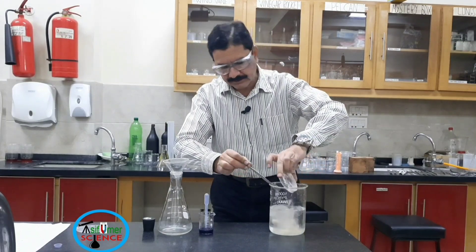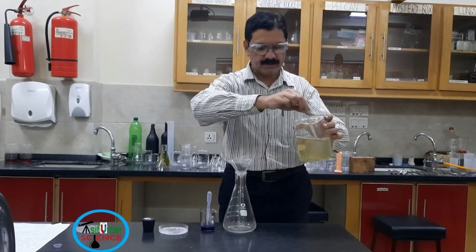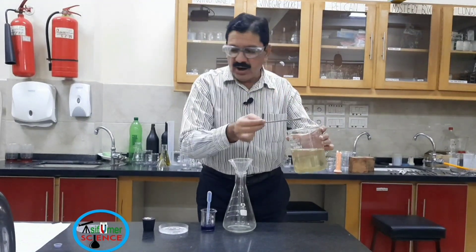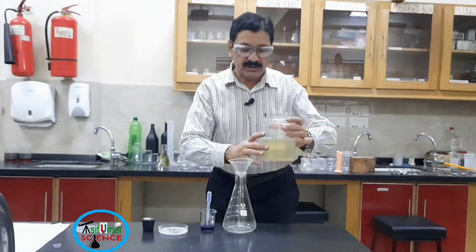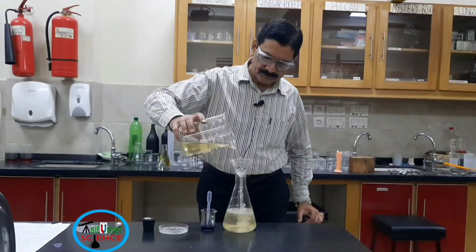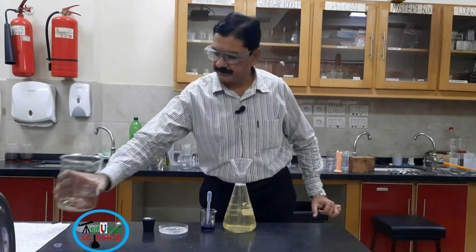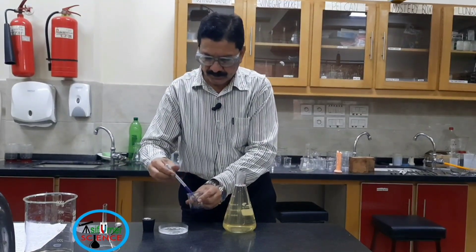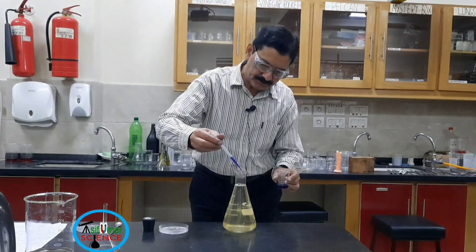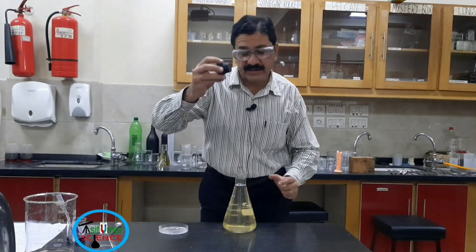Potassium hydroxide and glucose dissolve in water. Now I am going to pour all the solution into a conical flask with the help of a glass funnel. Now I am going to add a few drops of methylene blue indicator and insert the cork.